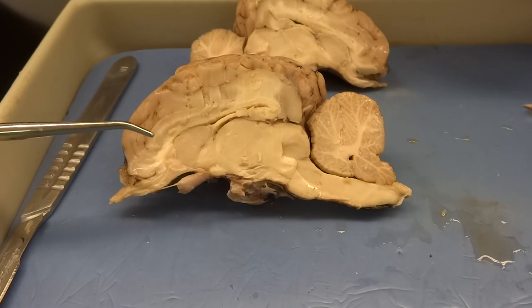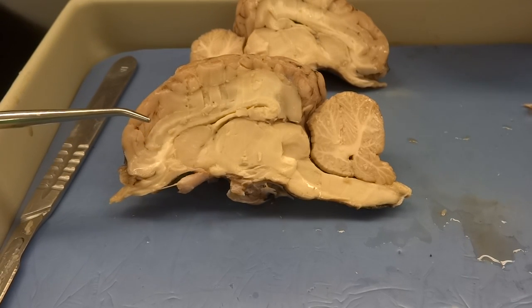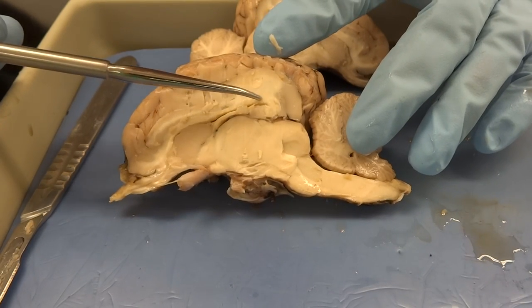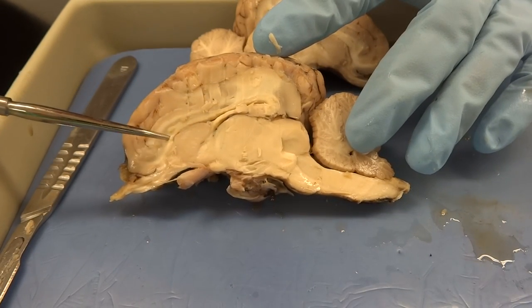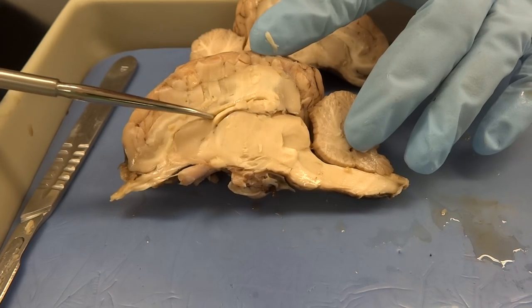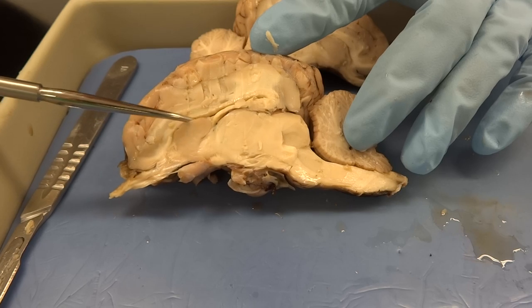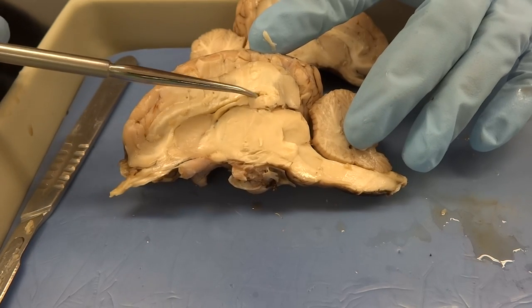We've done our cut right down the center of the brain and you can see the corpus callosum — it's been cut down the center. You can also see that there's a space in there, which is the lateral ventricle, filled with cerebrospinal fluid running throughout the entire brain.